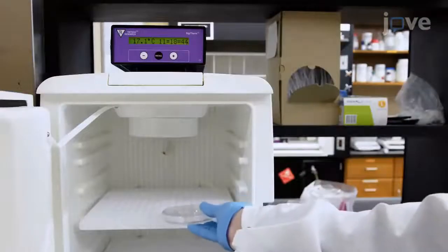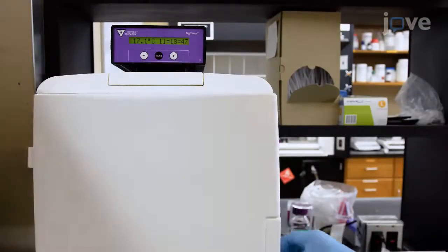Keep the fertilized eggs on the same dish at 16 degrees Celsius or at room temperature.